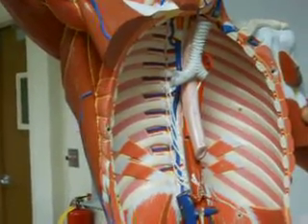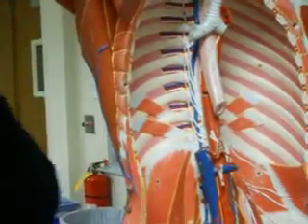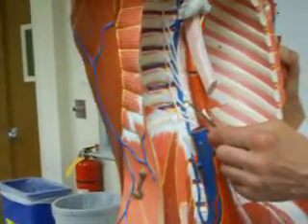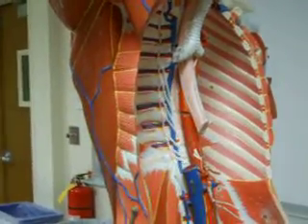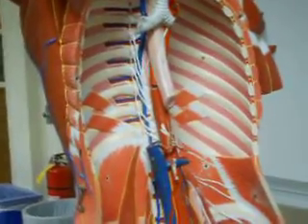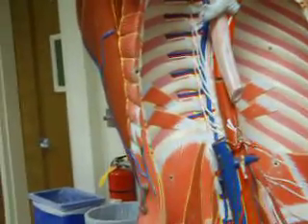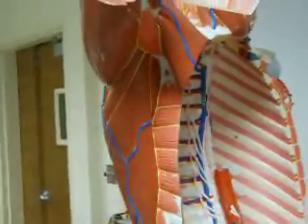So where is that? You have to look into the right side of the thoracic cavity, the descending blue vessel. The azygous vein directly receives the blood from all of these right side dorsal intercostal veins, and then indirectly gets the blood from the left side dorsal intercostal veins as well via a hemiazygous vein. So this is the azygous vein. I'm likely to ask the azygous or the hemiazygous.